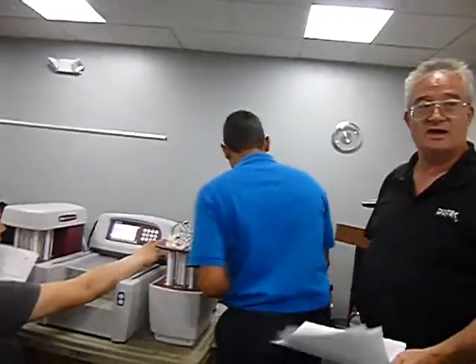There's nothing in any of this paperwork that's going to tell you that. That's just something that we learned by mistake with time. And I'm like, whoa, wait a minute, I just put all brand new lines on an older system. There's no way you're going to know until you create the method.